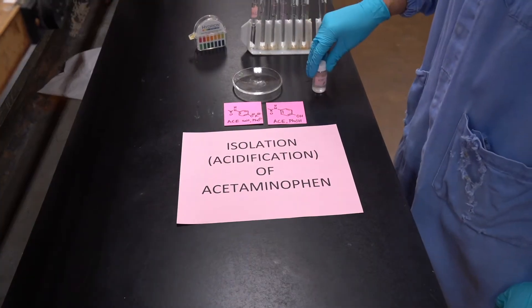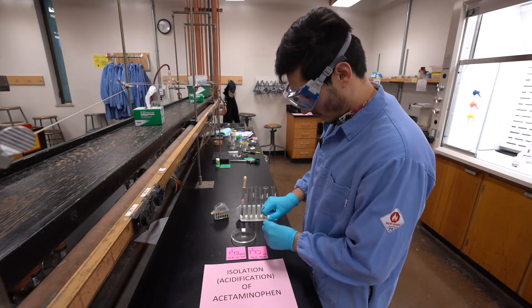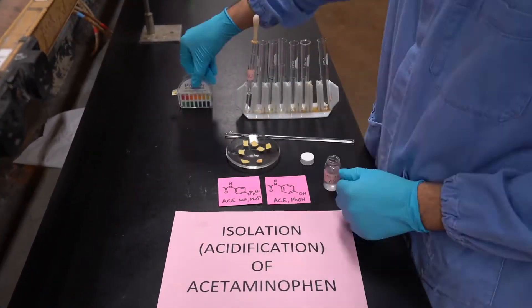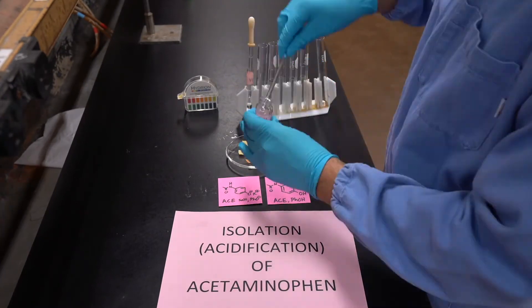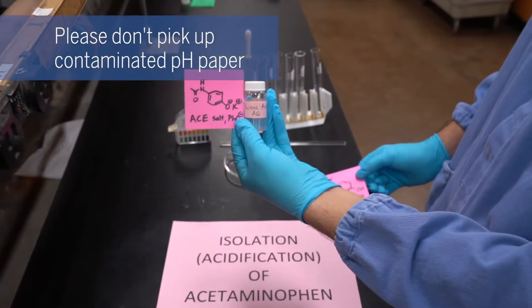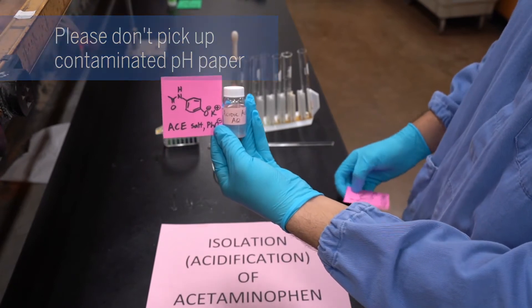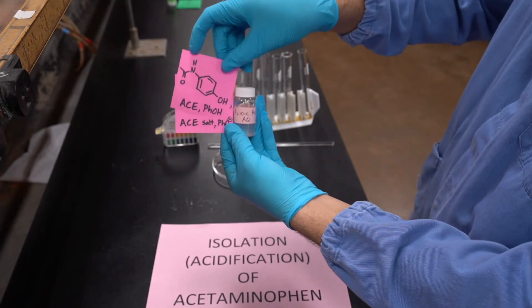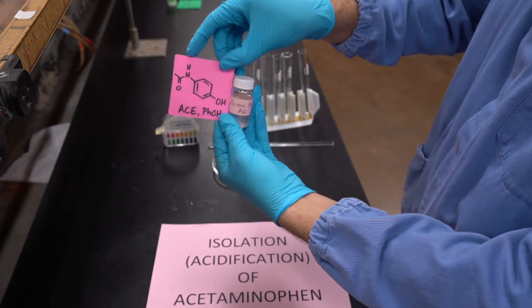Just as we did with our aspirin, we're going to go ahead and repeat the acidification, but this time with our acetaminophen. We did have our acetaminophen salt before, but once we added our hydrochloric acid, we reprotonated it and now we have our protonated acetaminophen back.